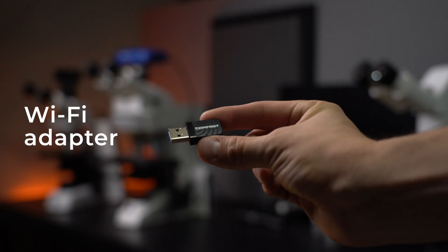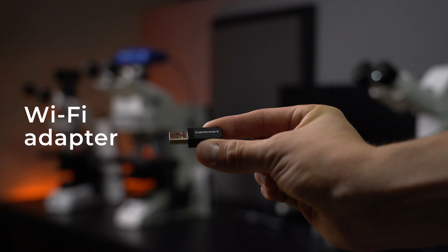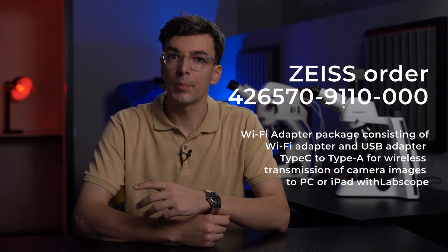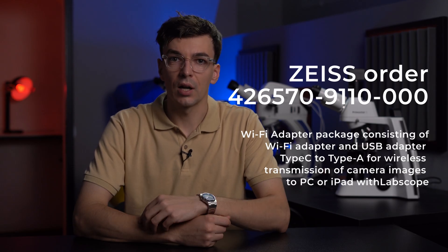For a Wi-Fi connection we need the following things. First, a Wi-Fi adapter. You can order it with Axiocam or buy it separately. Not every adapter is compatible. I found this Comfast and it works great.